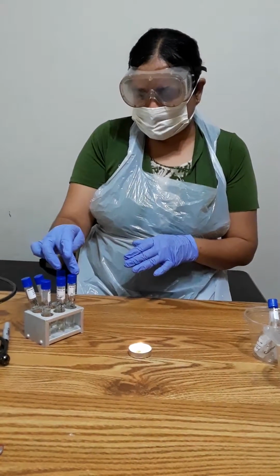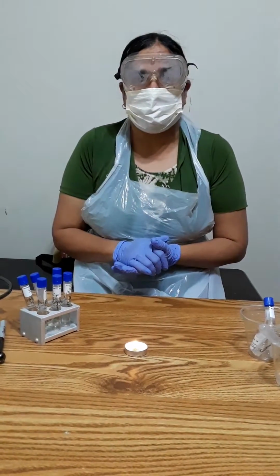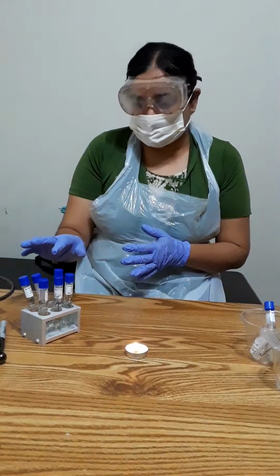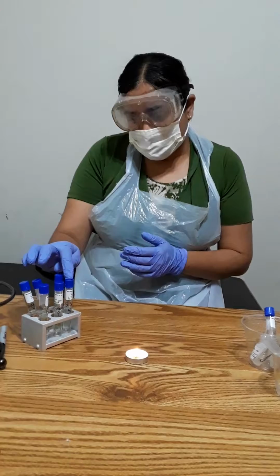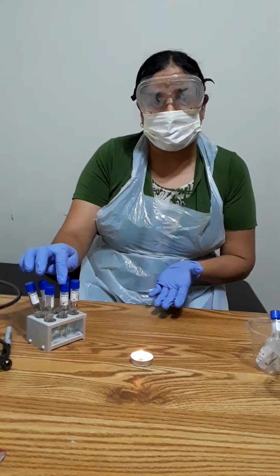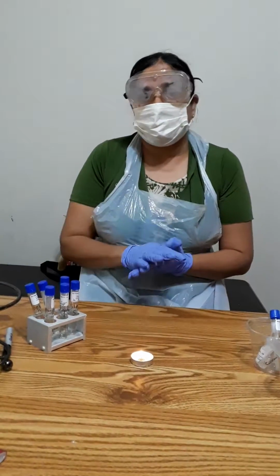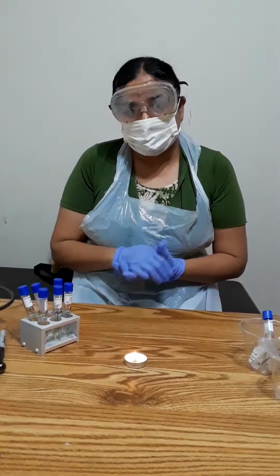This is for S. epidermidis and this is for yeast, and I'm going to keep them for 24 hours and see if there's any turbidity. That means a positive test; a tube having turbidity means that the microbes grow well in that pH. If it's in 5, that means they like an acidic environment. If it is in 9, that means they like an alkaline environment. And if there is turbidity in tube number 7, that means they are neutral. They don't grow well in an acidic environment, neither in an alkaline environment.